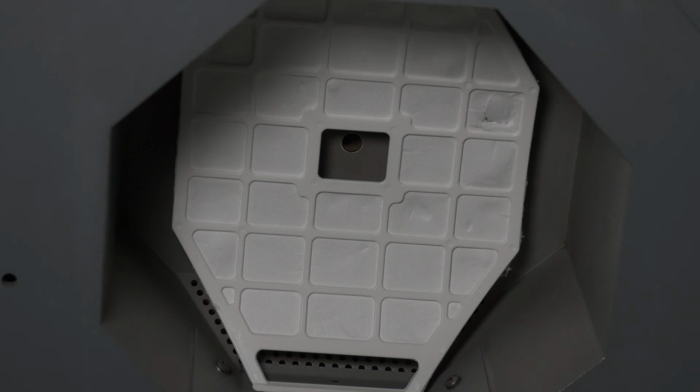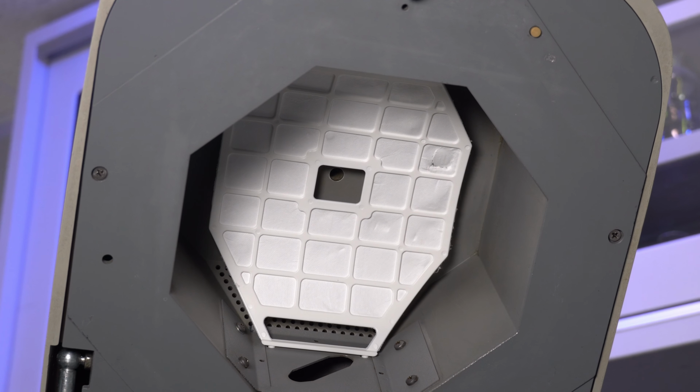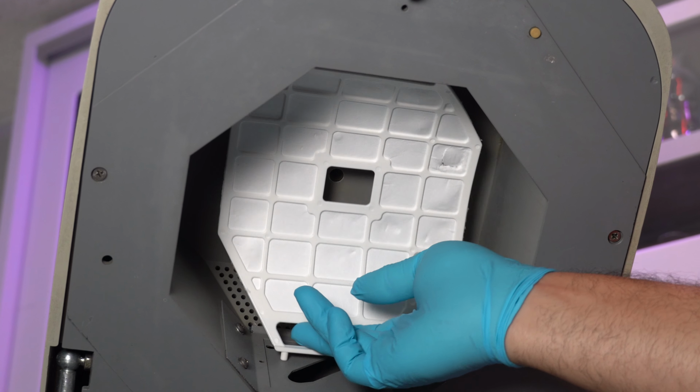We're going to check the Airshield and make sure it's installed correctly and verify the motor blade is rotating properly. If you look through the square hole in the Airshield, you should be able to see a rotating blade. If not, remove the Airshield by pushing it towards you, pulling down and out.